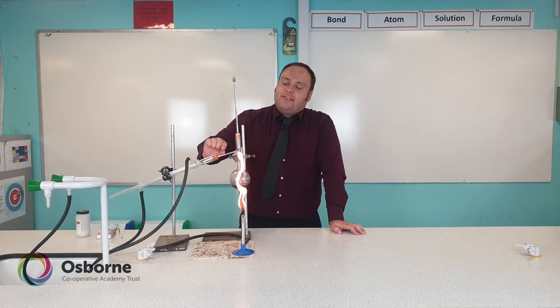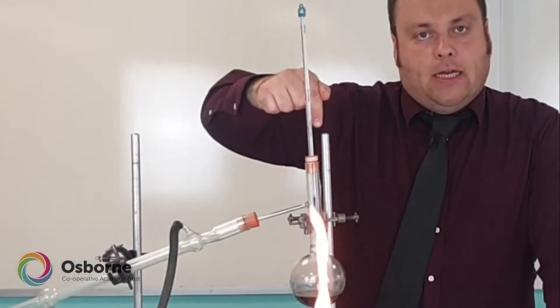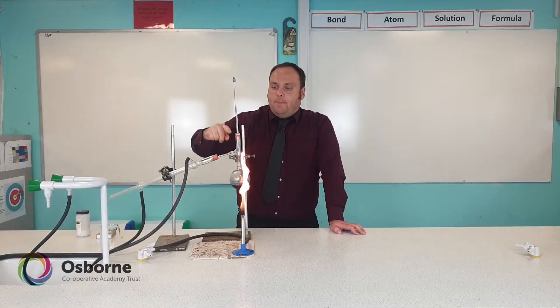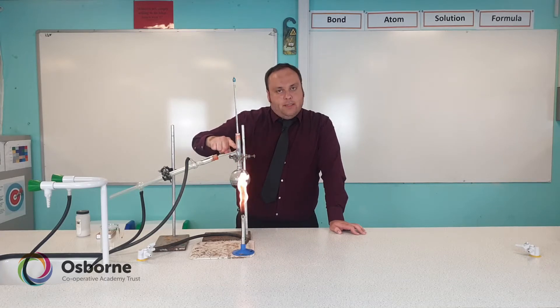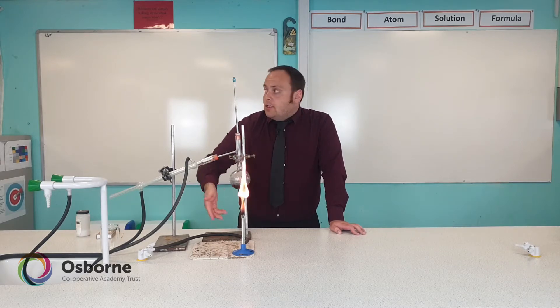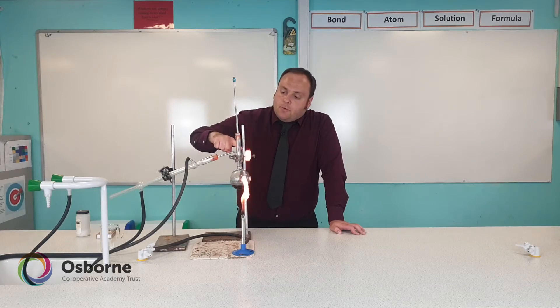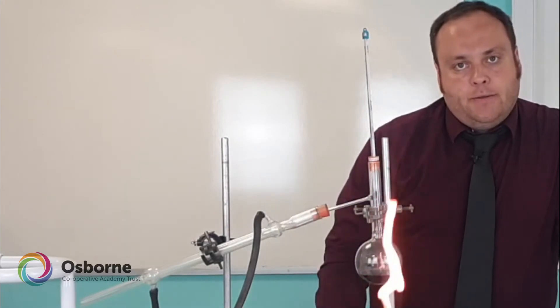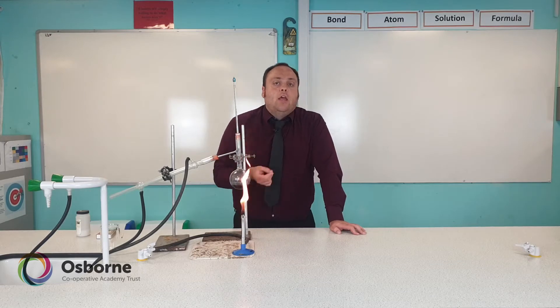Up from the round bottom flask there's a sidearm, and the top has a bung with a thermometer in it. The bung stops anything from escaping as a gas, and the bulb of the thermometer needs to be level with the sidearm. When the Bunsen burner is placed underneath, it will boil the water and turn it into steam, so we want to record the temperature of the steam as it starts to exit the flask. If it gets too hot, I can turn the Bunsen burner down or move it away.